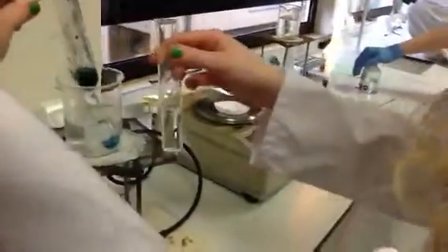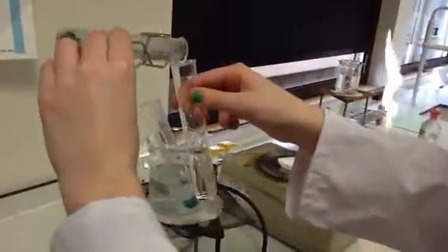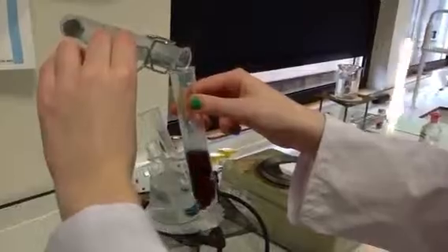Go Hayley. We are going to hopefully make red.